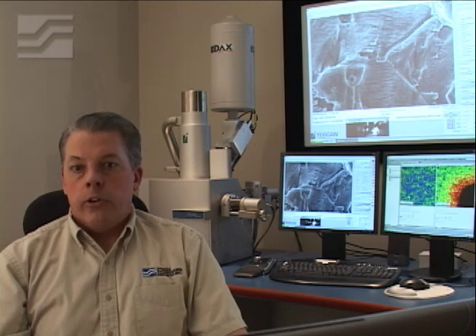and crystallographic information onto a large screen in the SEM room and to an even larger conference room, so that our clients can comfortably participate in the examination of their samples. We can also transmit live images and data directly to your computer at your office or home.